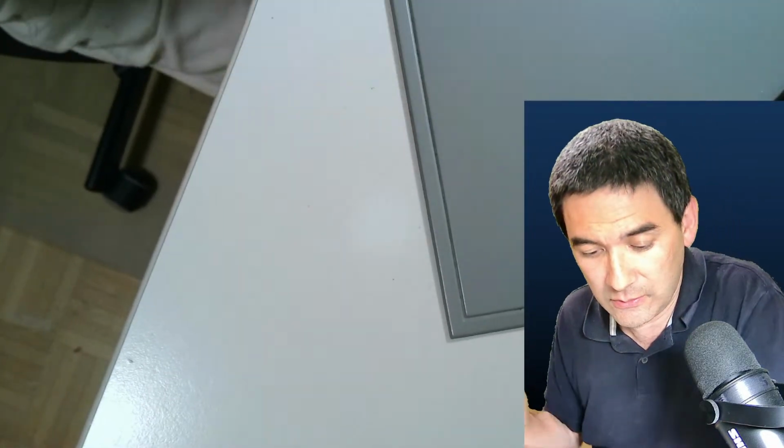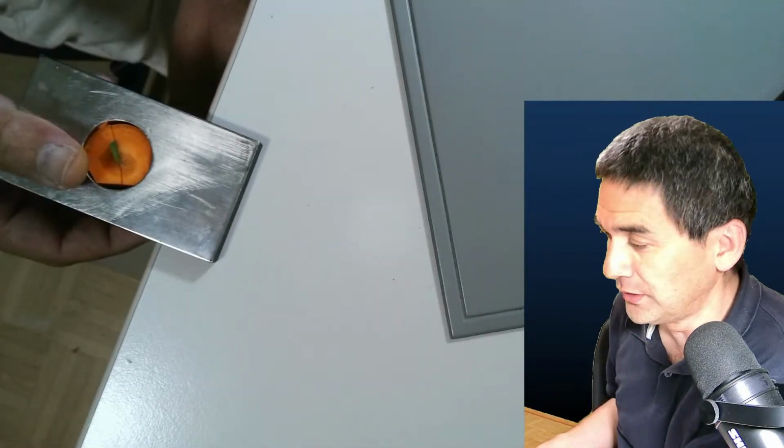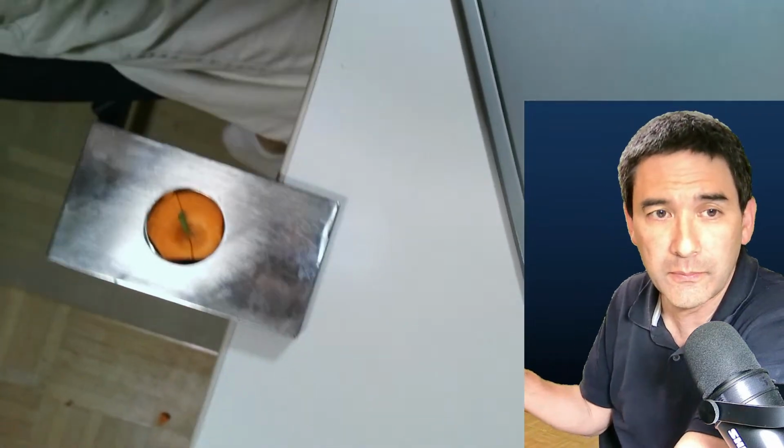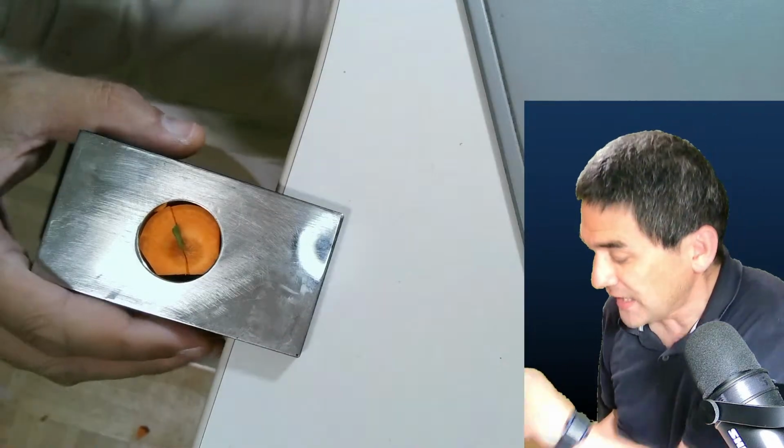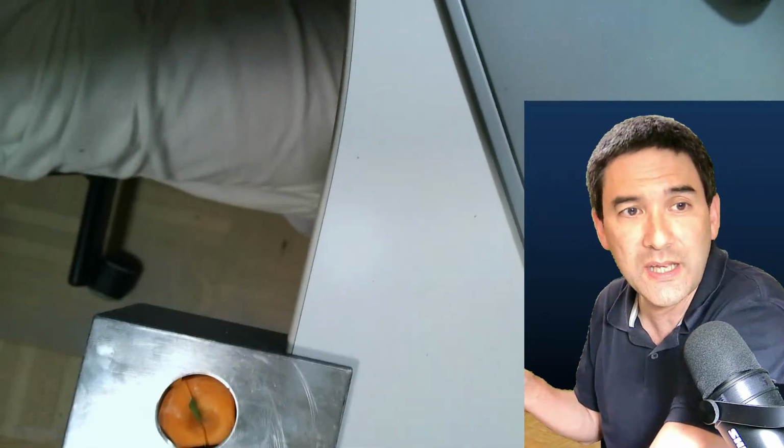So, yes, I see that there are people asking, is this a microtome? So maybe you just joined in the chat or the live stream. Yes, I'm just showing you my new microtome, which just arrived a couple of days ago, and which I kind of like a lot. Again, each device has its own advantages and disadvantages, but this one actually has, I would say, more advantages than disadvantages.